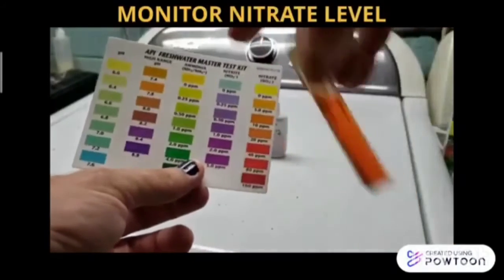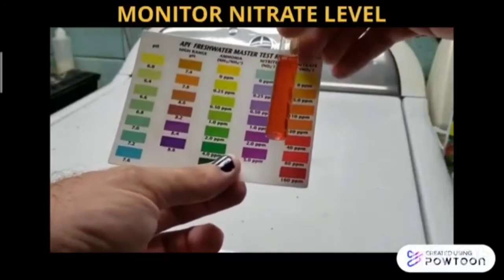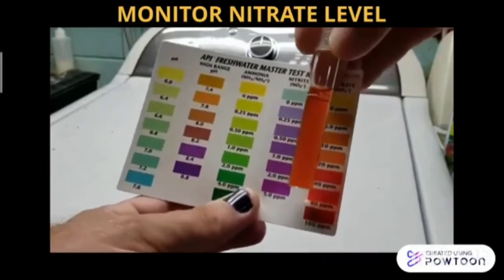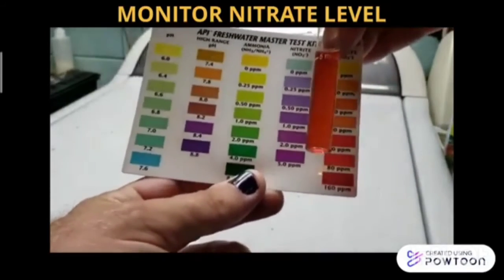For the monitoring of nitrate level, similar to the ammonia test kit, prepare a nitrate test kit and repeat the steps. If the color changes to orange according to the color indicator, the nitrate level is high.